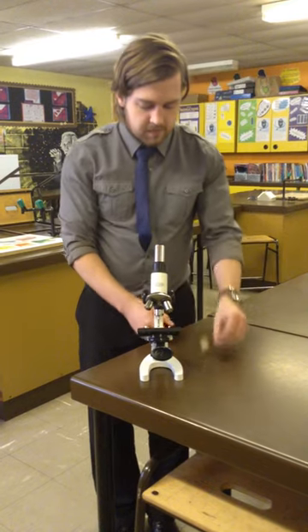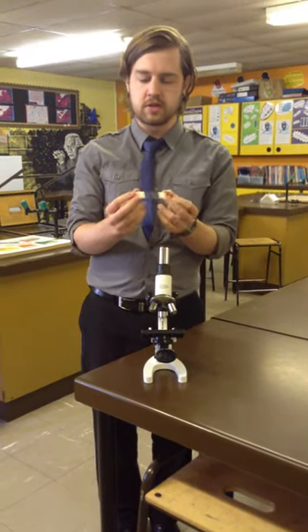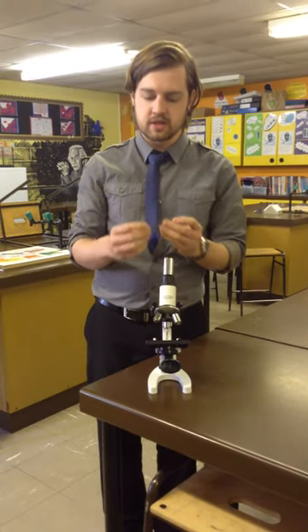Perfect. Okay, you're then going to get your microscope slide. Now be careful with the microscope slide because it is very sharp on the edge. This is glass.